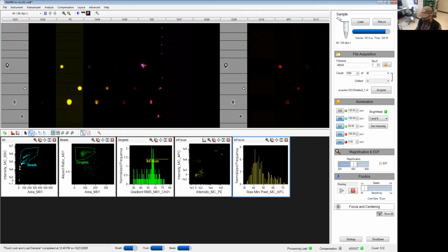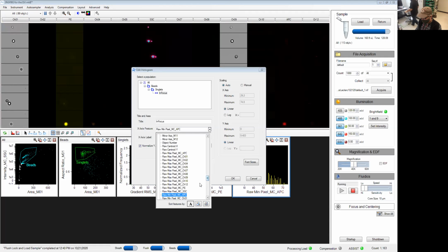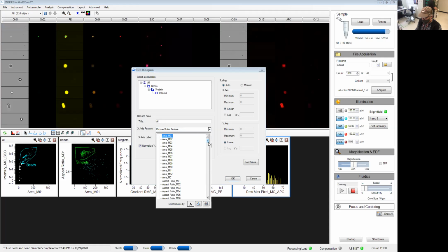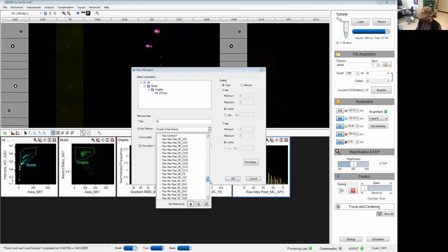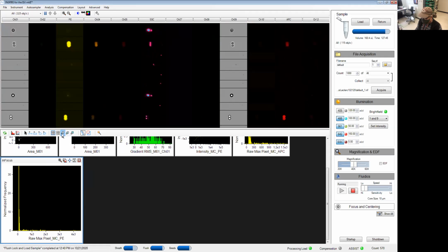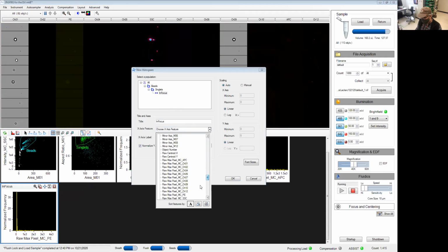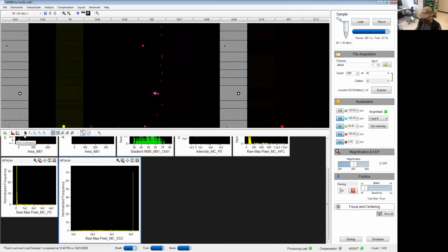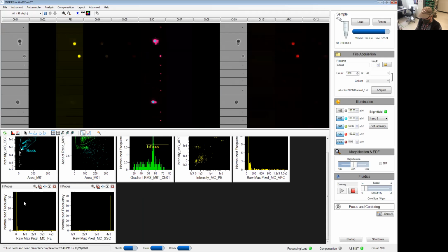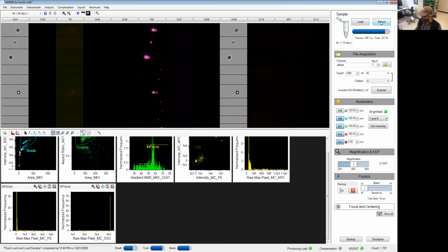We'll make one for APC, max pixel APC, one for PE, one for the side scatter. So this looks pretty good at this point. I don't have that many events piling up. Increase it a bit.